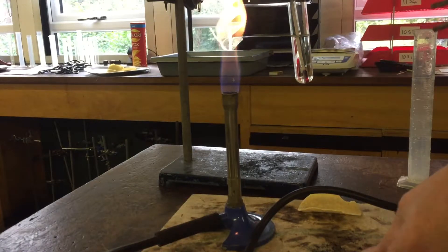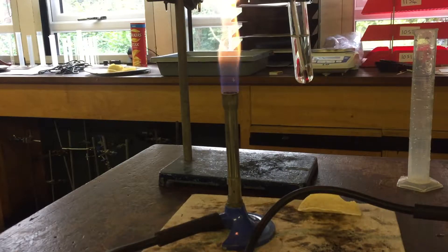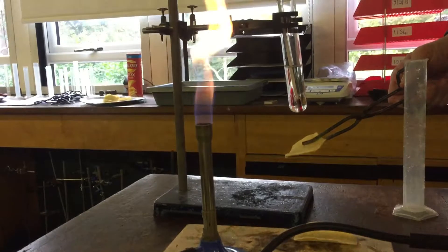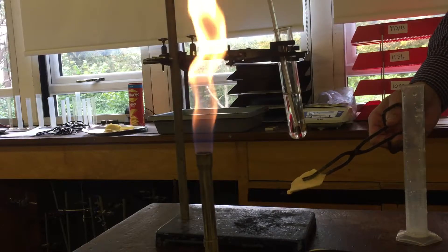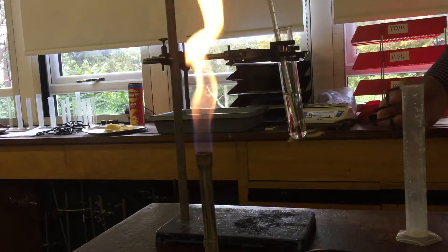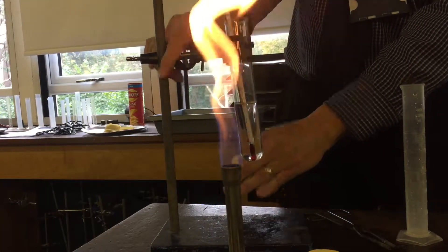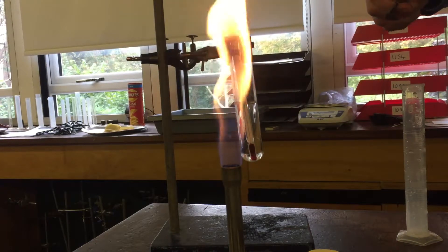We're going to ignite the crisp — just hold it over the Bunsen burner briefly on a blue flame to light it. You need to wear goggles. Another controlled variable to consider is the distance between the boiling tube and the crisp. If you hold it really close it gets more energy; too far and it gets less. Try to keep the distance the same — about 5 centimetres. Position the tube over the heat-proof mat so any bits of burnt crisp fall away safely.